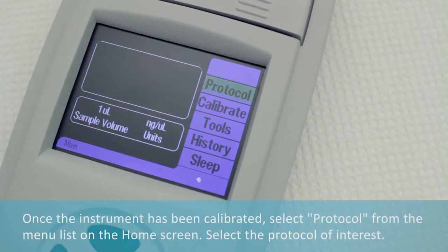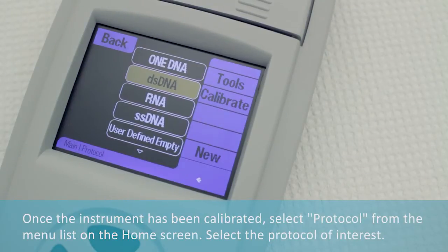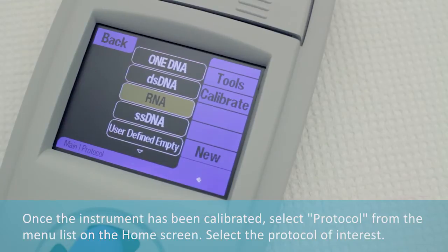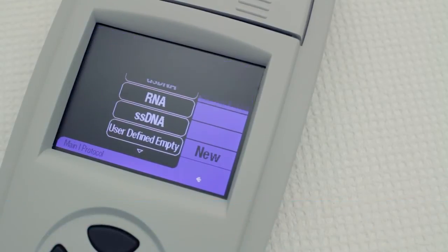Once the instrument has been calibrated, select Protocol from the menu list on the home screen. Select the Protocol of interest.